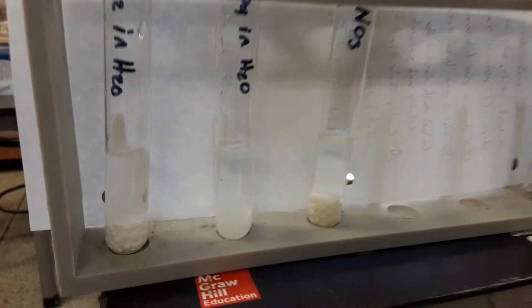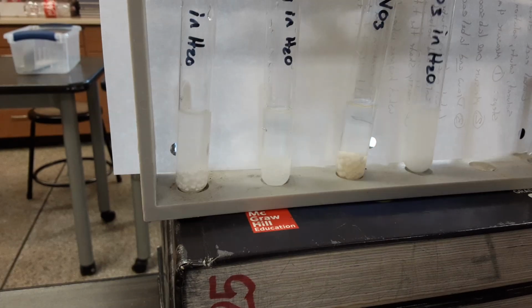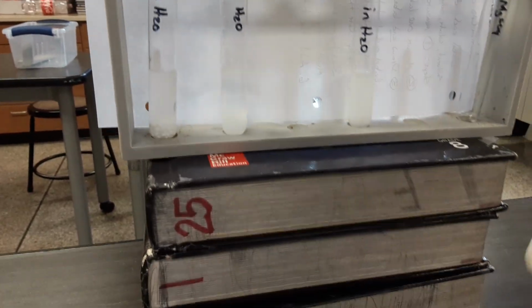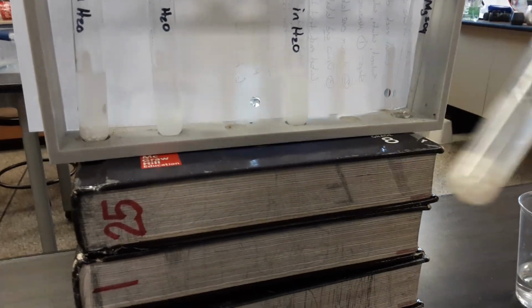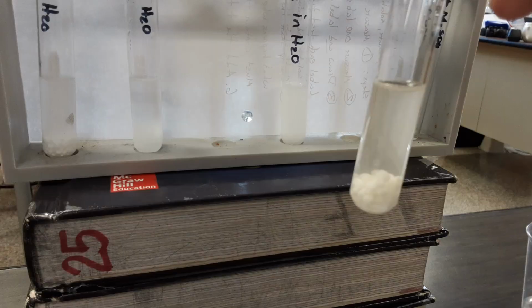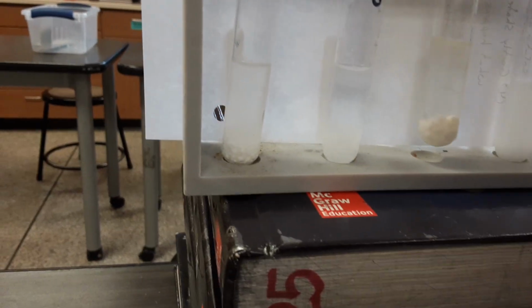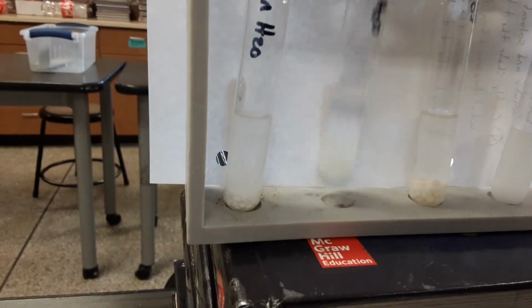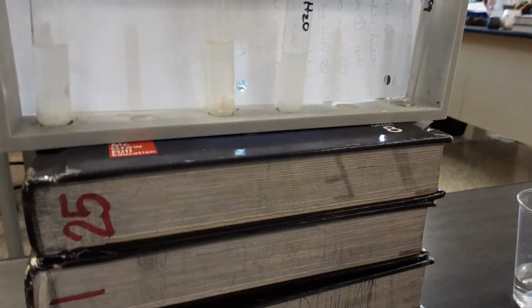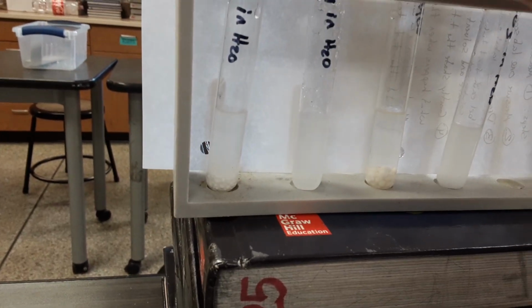And the instructions say to agitate the test tube. So we're just going to give a little shake just to make the mixing occur. We don't want to just stratify. And you can tell that some of the solute, that's the solid material at the bottom, is becoming dissolved in the liquid. This does not happen instantaneously. It does happen more quickly when the solid material is more finely divided.